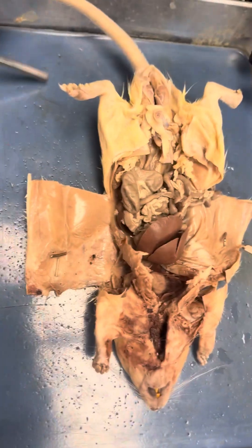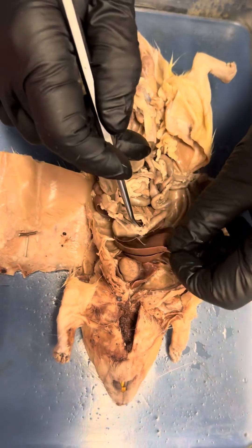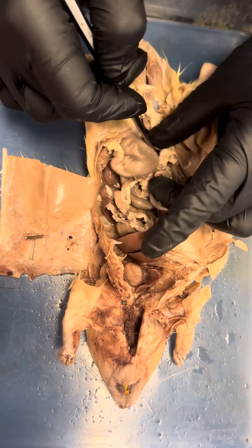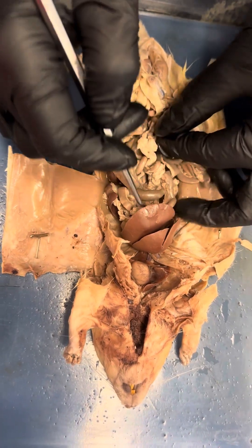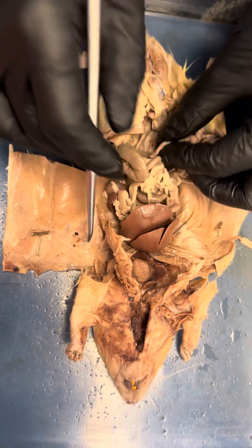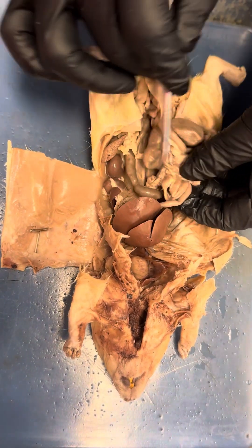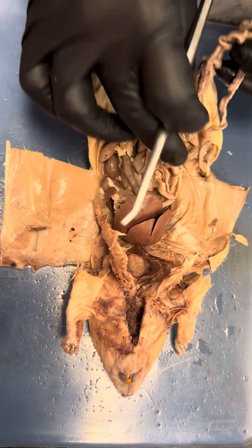Now for the male — for the male, we have the same organs, all the same structures. I can also show you the mesentery. See, all the intestines are connected with the mesentery. But they already removed all the mesentery — it was dissected before, that's why.